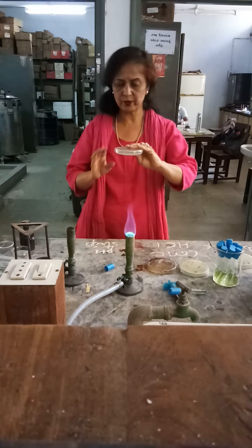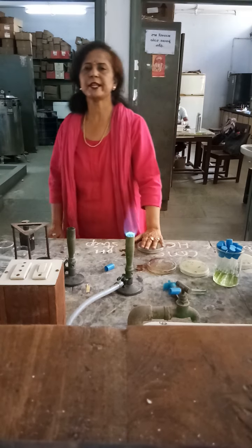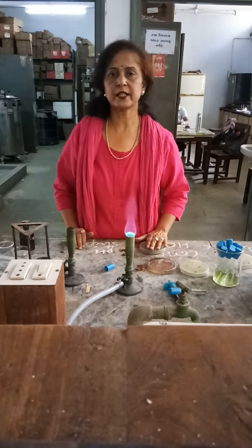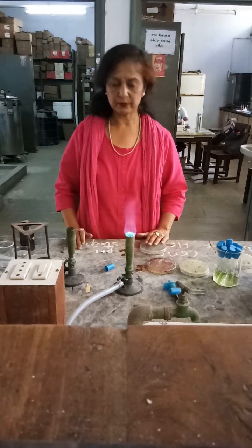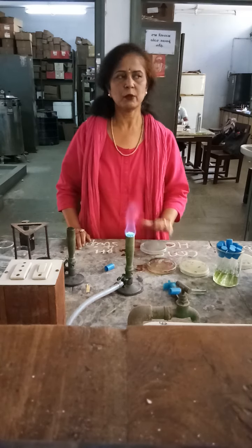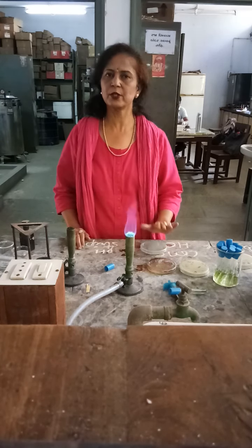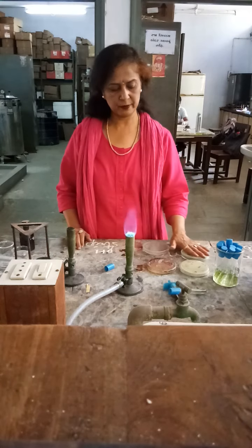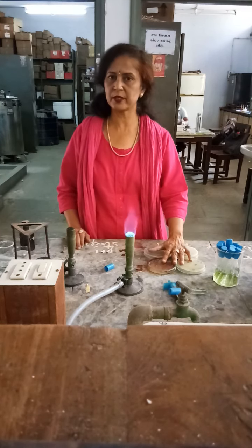This plate has already been grown with bacteria. Now this plate is to be kept for another 24 hours at 30 to 37 degrees centigrade to get the conclusion on whether our test organisms can be inhibited by the antibiotic-producing bacteria. That covers the primary screening of all three different groups of bacteria.